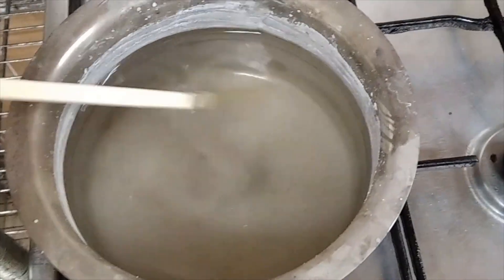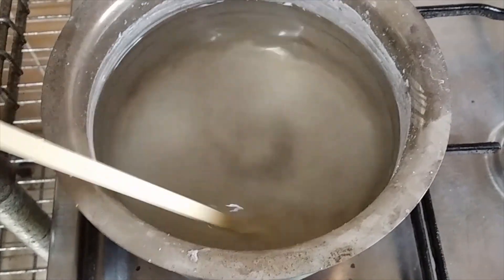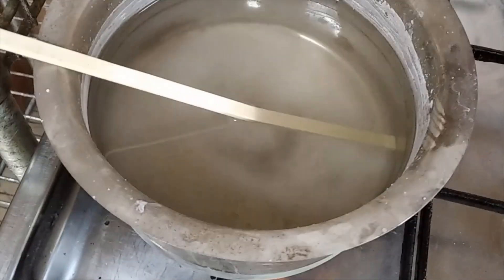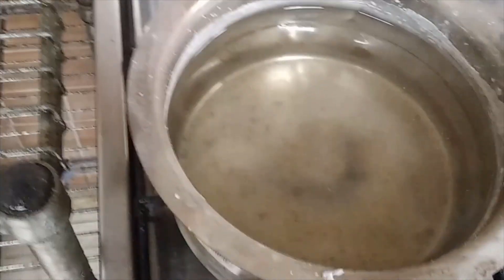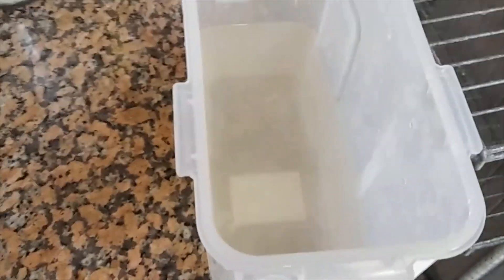You can see this is still dissolving. Once it's fully dissolved, the next thing we do is put it in the freezer — this is your classic method. The very first iteration is the classic fractional crystallization. Once everything is fully dissolved, we're going to pour it into this container and put it in the freezer. We're using plastic to get nice large crystals. We put cling wrap over this to prevent evaporative losses, which would cause sodium contamination in the product — you want to minimize that. A while later, we collected about this much potassium chloride from the mix.